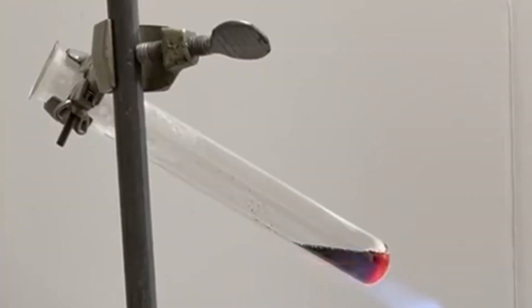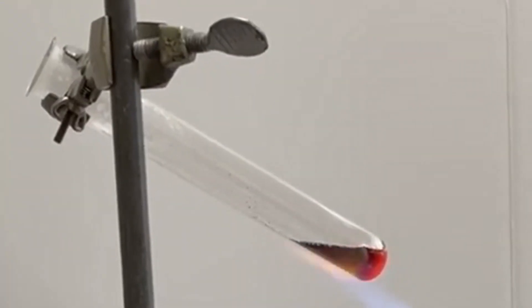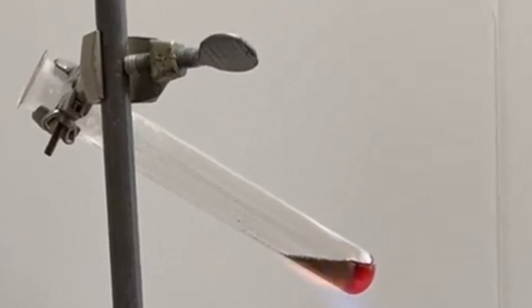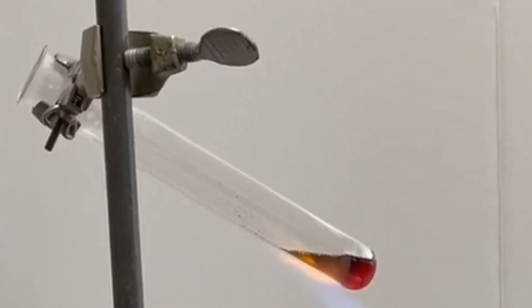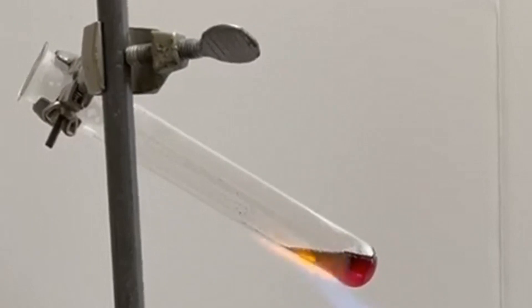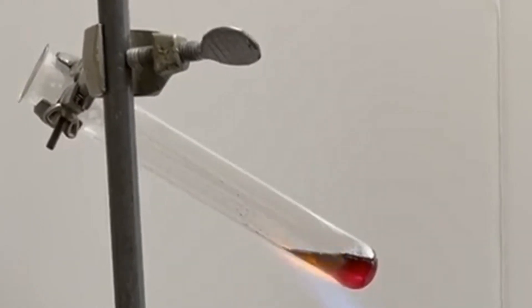Finally, I'd like to show you one particular experiment I did where I was heating sand and magnesium together in a test tube. In this case, some flammable gases must have formed because it shot a flame out of the test tube. Check it out.